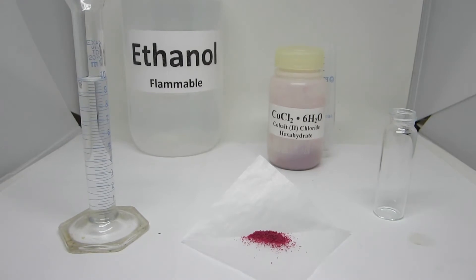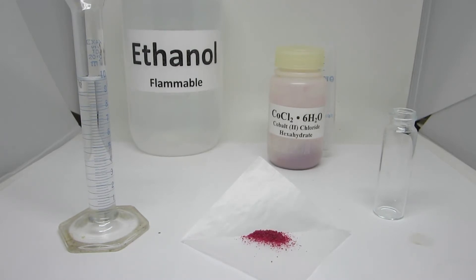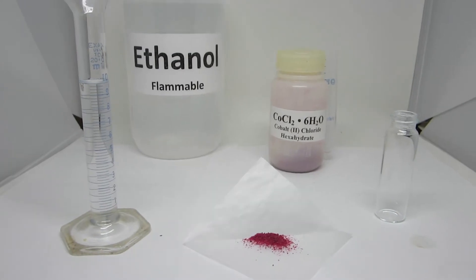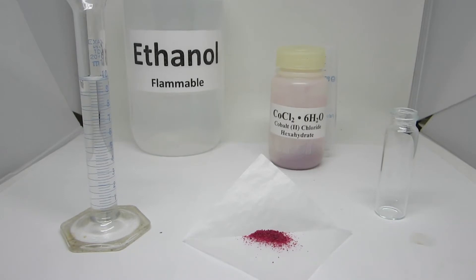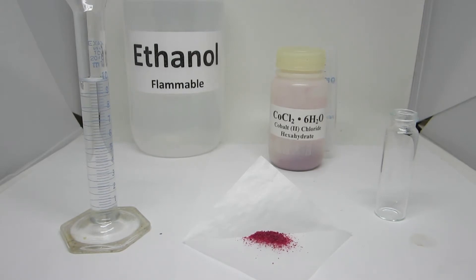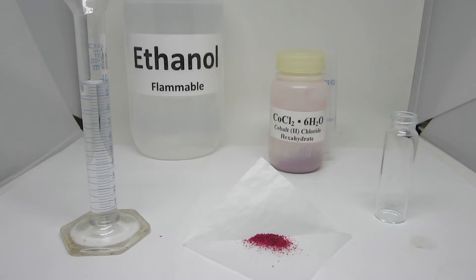This reaction looks at the equilibrium between two complex ions: the cobalt-tetrachloride complex, as well as the cobalt-hexa-aqua complex. These two compounds have very distinct and separate colors, which can indicate whether one is present or not. This experiment looks at how different factors can affect the equilibrium, and you can therefore measure the exact amount of one or the other.